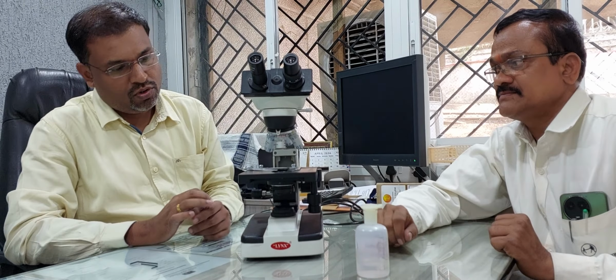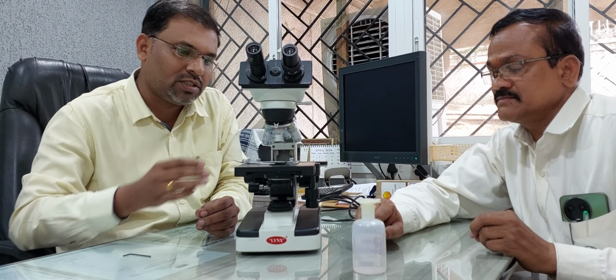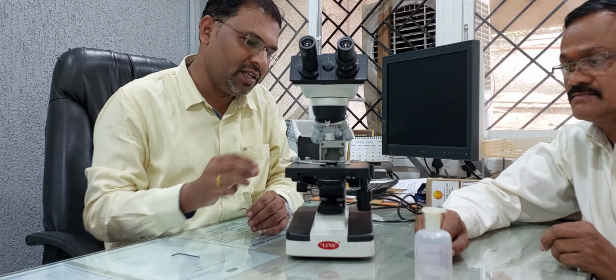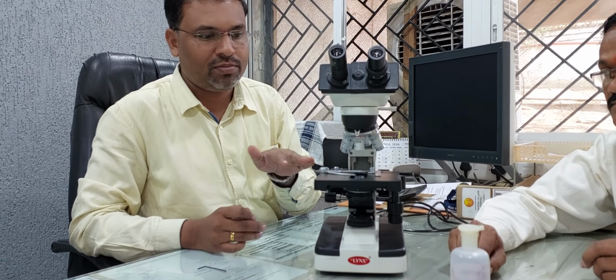Hello guys, today we are going to make a video on troubleshooting the movement of stages of the microscope. Actually, this is a binocular microscope. Sometimes doctors or technicians complain that there is a movement issue of the stages, related to the fine adjustment not being done properly and all that.